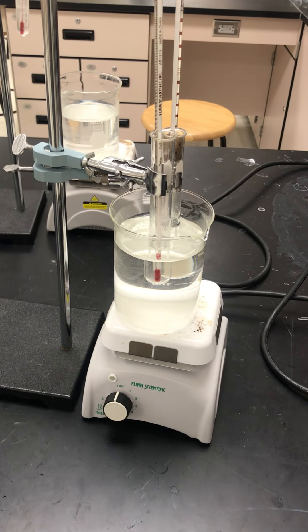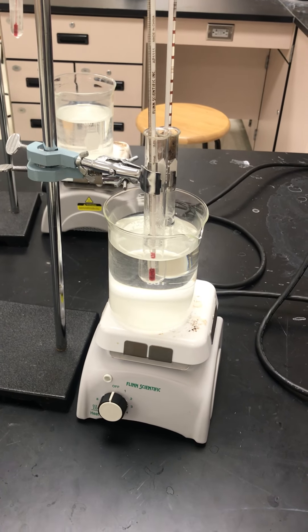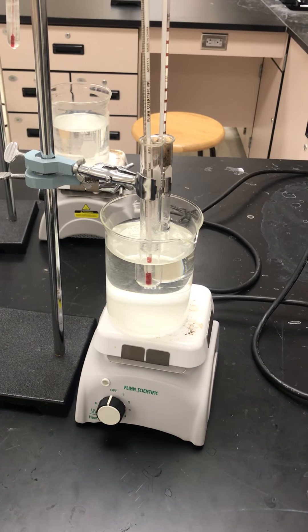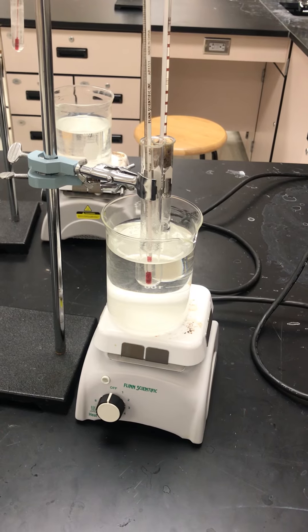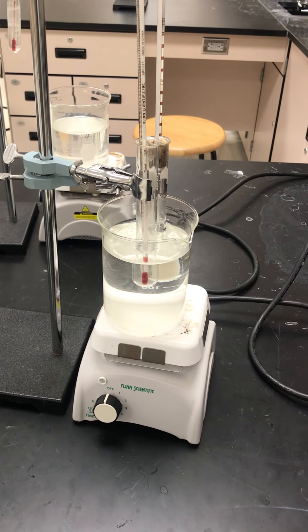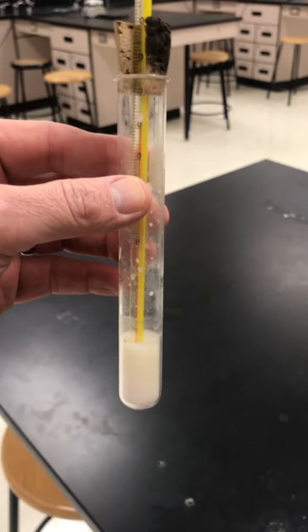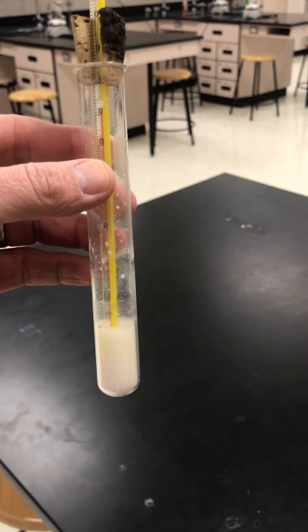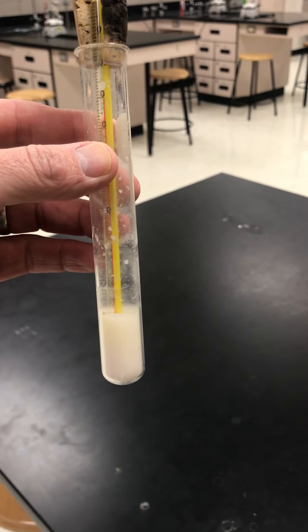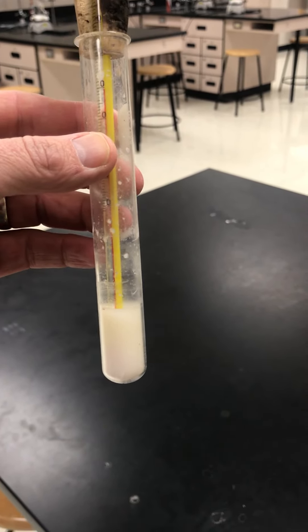All right, good morning 9th graders. I was going to show you quick what this lab is that we're doing Wednesday, Thursday for those of you that are gone. So we're starting with this stuff right here. This is called stearic acid and it's in a solid form. It's actually animal fat.